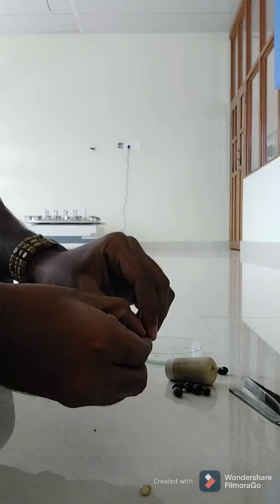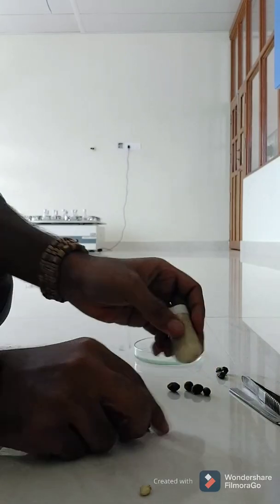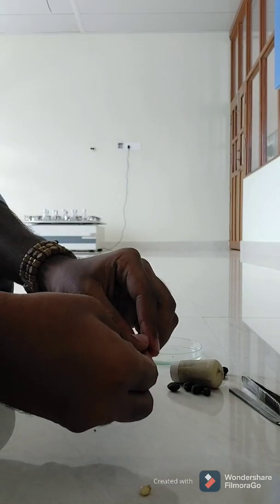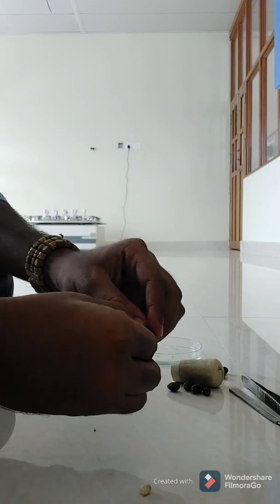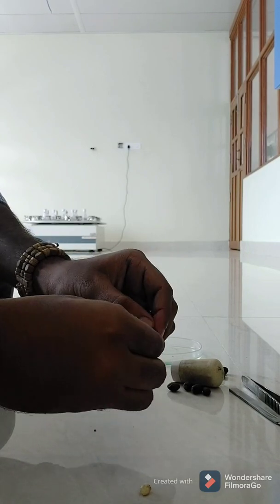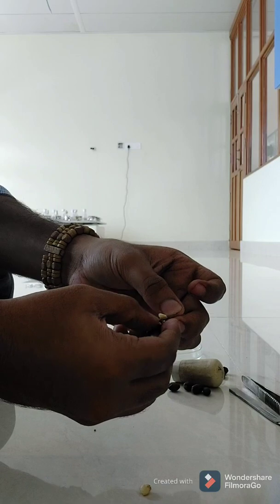When you break open the fruit wall, be careful that the seed is not damaged. Make sure you are taking the right-aged or mature fruits so that the embryo is also mature. You cannot take an immature embryo and place it on the media — it will not germinate. You need properly matured fruits. Once I break open the seed, a beautiful embryo can be seen. We have taken the fruit, broken the fruit coat, removed the whitish seed, and now we will take it for surface sterilization.